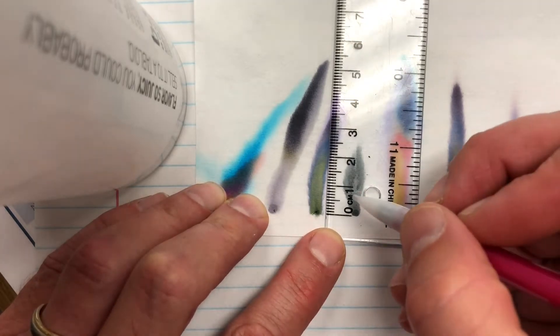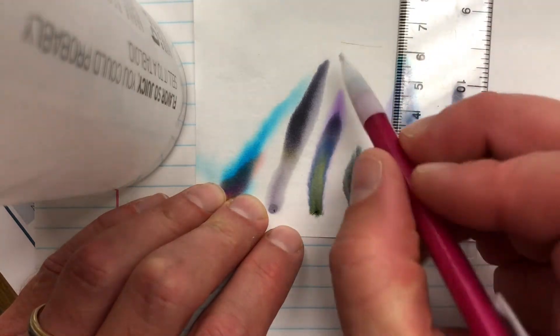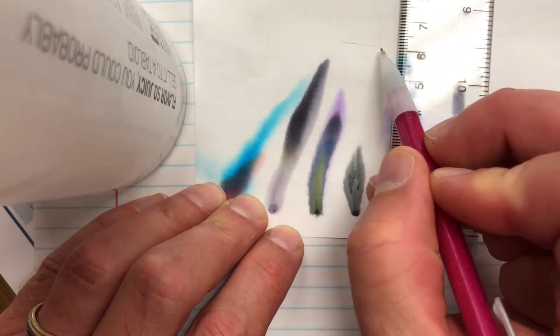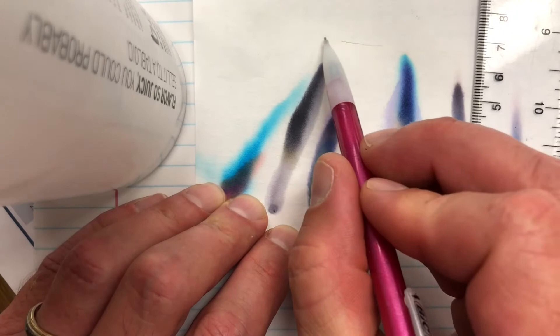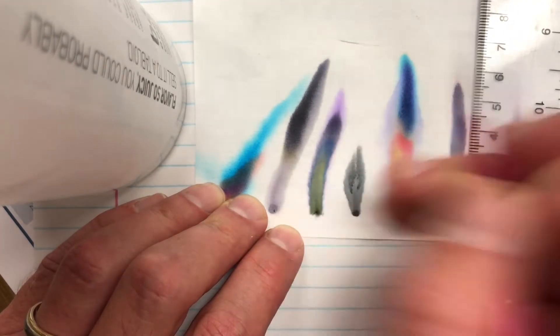I can try to kind of hit it right in the middle there, all the way up to where the water traveled. I know you probably can't see it, but if you look really close, there's actually kind of a dingy orange line where the water ended and I drew a little mark there.